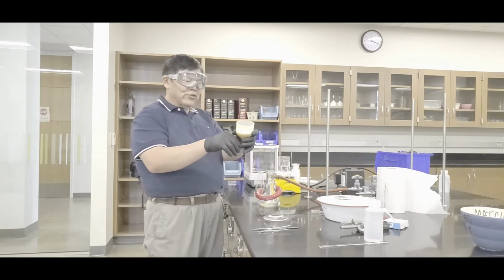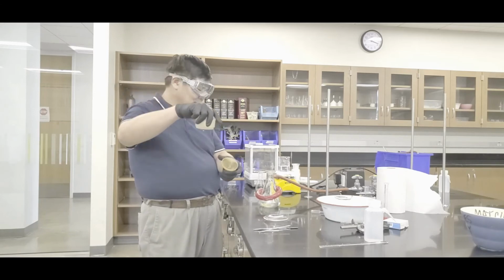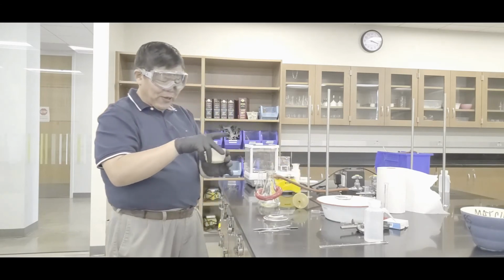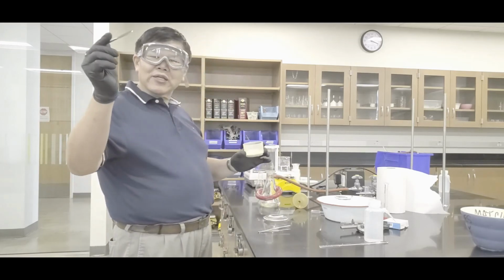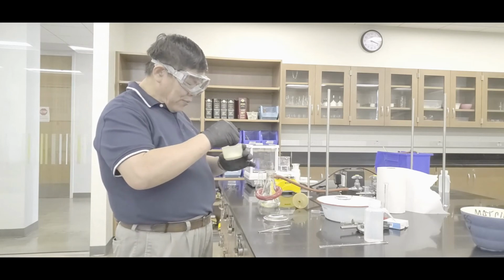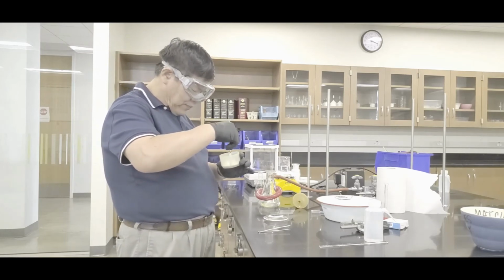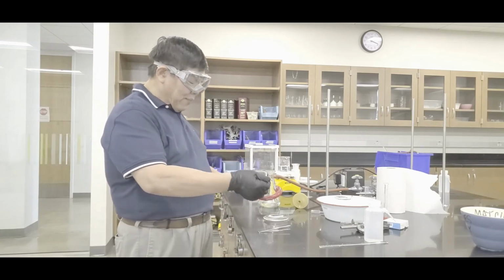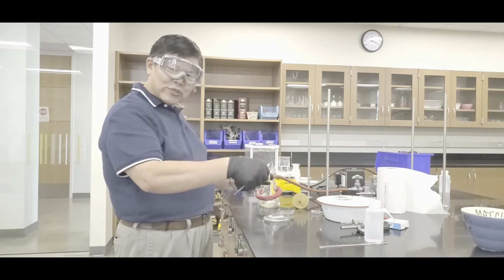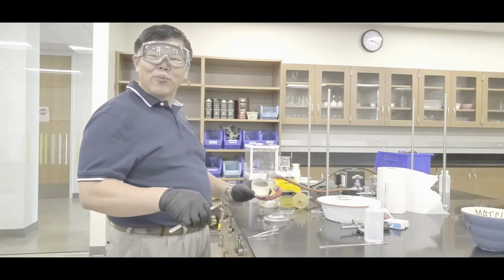And then what you then do is this. Separate by twisting, okay? Like that. The goodies are up here. Now what you then do is use the spatula to try to pry the edges of the filter paper. Okay, and then you're going to try to lift it up and then use a tweezer and try to slide it. Oh boy, I'm bad at this one, so I hope it works.